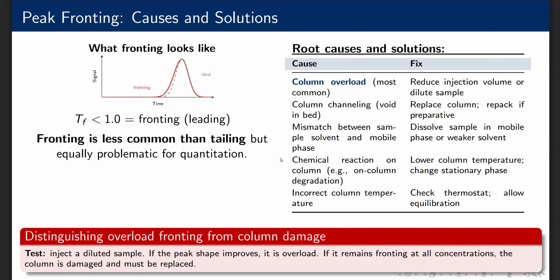The diagnostic test described in the red box is invaluable. Inject at half concentration. If the peak becomes symmetric, you have confirmed overload. If it remains fronting regardless of concentration, you have a column problem, usually a channel or void in the packing bed, which requires column replacement.